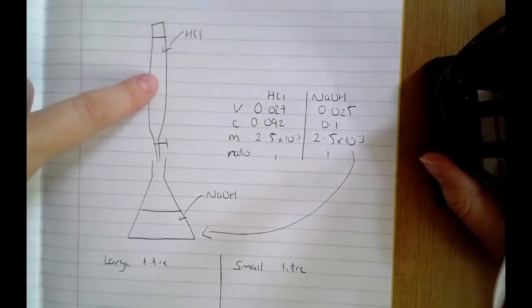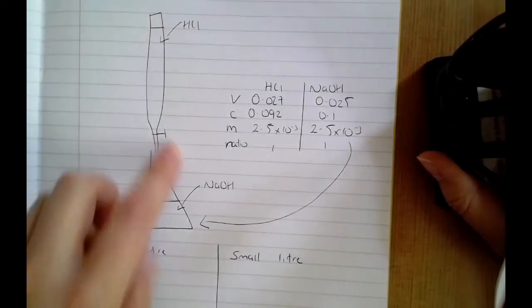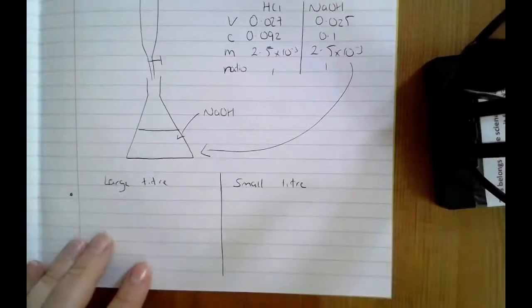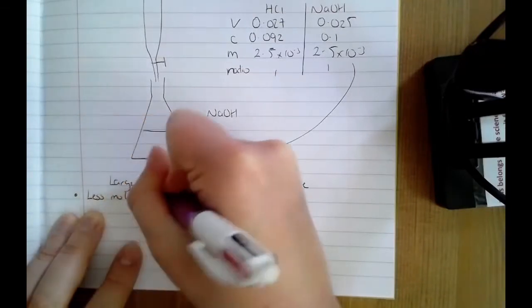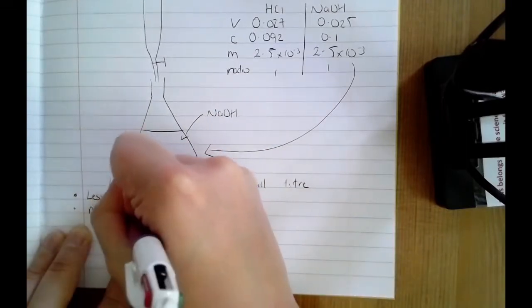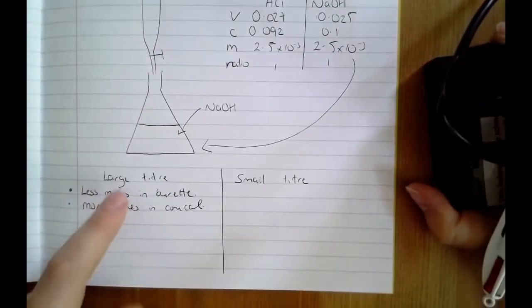And again, it doesn't matter what's in your burette, whether it's the acid or the alkali, whether it's the unknown concentration or your standard solution, these answers will apply regardless of what's in your burette. But if you've got a large titre and you've added more than everyone else, we need to look at the reasons why. If you're adding more than everyone else, it's going to mean one of two things. If you had to add more to see that colour change, you have either got fewer moles in the burette than you're supposed to, or you have got more moles in your conical flask than you are supposed to. That's what would result in a larger titre.